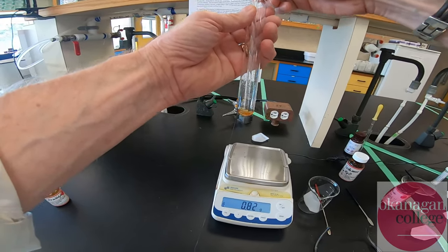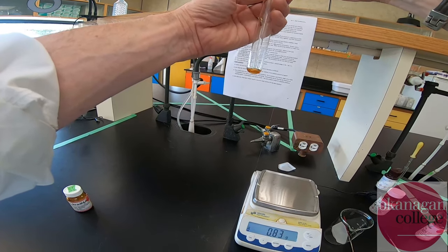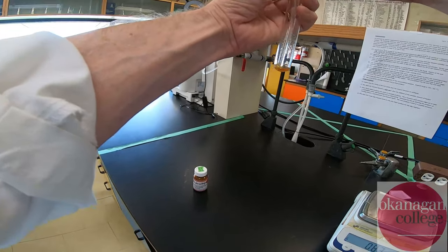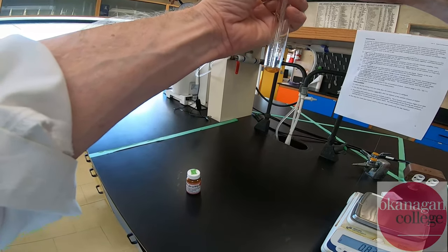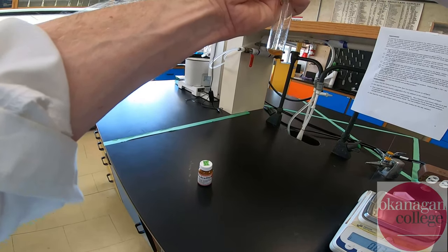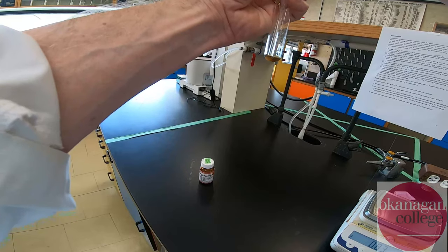The sodium hydroxide has been added and off we go. The key to this part of the experiment is we keep this thing moving. As the reaction occurs we're going to start to get solidification, and it has a hard time dealing with fusing itself to the bottom of the test tube. As the reaction proceeds we go from a liquid to a solid — effectively a freezing of the material. Two molecules become one molecule, which is going to be an exothermic process. We expect this to get hot — not massively hot — but that's a good indication that the reaction is going forward, coinciding with solidification.